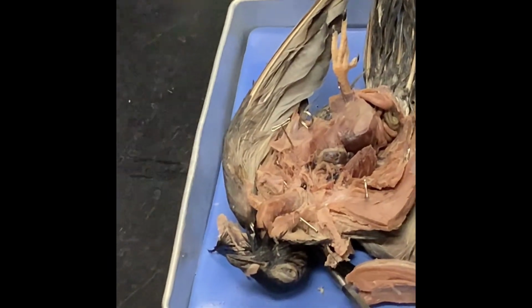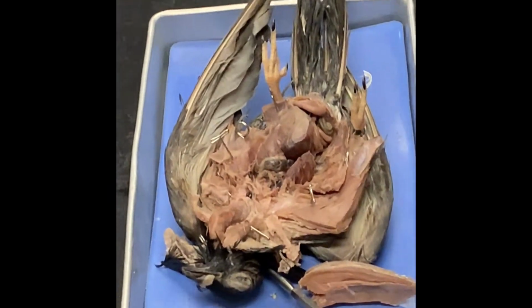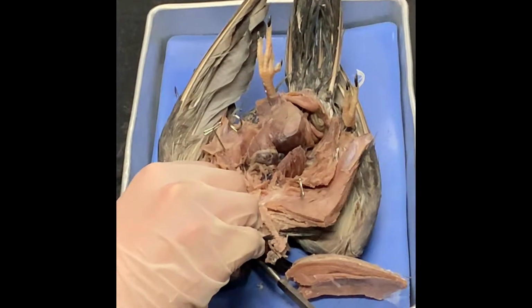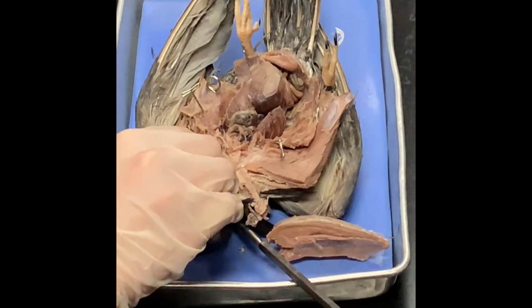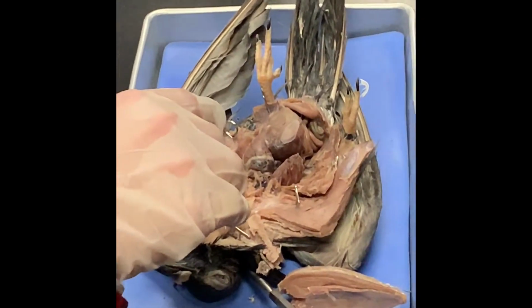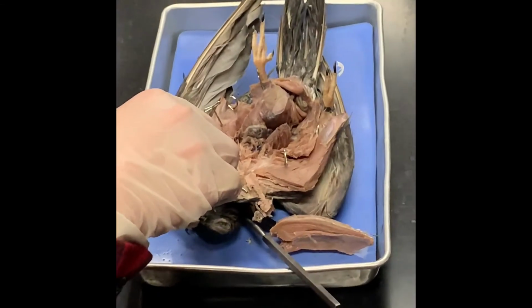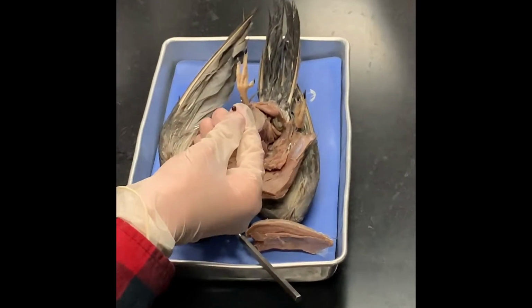What does the crop do? It's mainly for storage, right? Crop is for storage. Yes, okay, that makes sense. The crop is like a bubble, and the gizzard and the stomach are underneath it. But the crop is actually a very large inflated sac that fills up a lot of the anterior part of the bird there. But it gets punctured when you take the keel off.